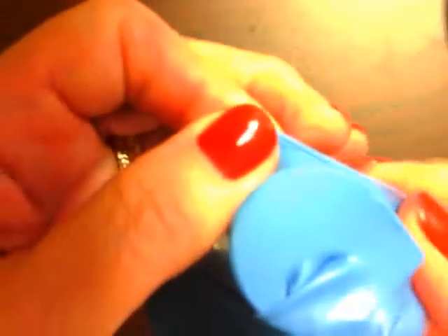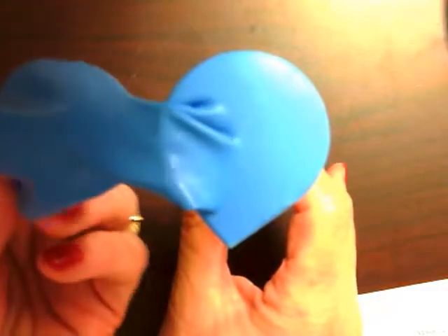Now we're ready for the reaction. We take the balloon with the baking soda in it and very carefully place it over the top of the cylinder that has the vinegar in it. And now I'm going to take the baking soda and spill it all in there. Whoa, it immediately reacted, and you can see that it's blowing up my balloon. Also, you should be able to see the bubbles here being formed. I have lots of bubbles, and I can hear the sizzling. Maybe you can too. My balloon feels very cold too, by the way.